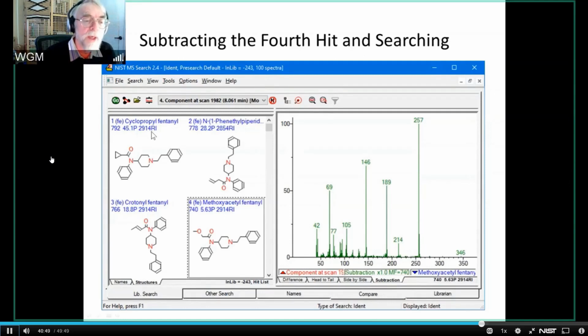They don't help us as much as we'd like, but we look at the retention index and we find that the cyclopropylfentanyl has 2914, the crotonyl fentanyl has 2914, which is in and of itself surprising, and the methoxyacetylfentanyl has 2914, and this other fentanyl up here is at 2854. Now, assuming that the retention indices that we've got are even remotely good, then what we've got in that mixture is likely to be something like these. We know it's this one. There's nothing else that was very similar to that retention index, but we don't really know whether it's this one or this one.